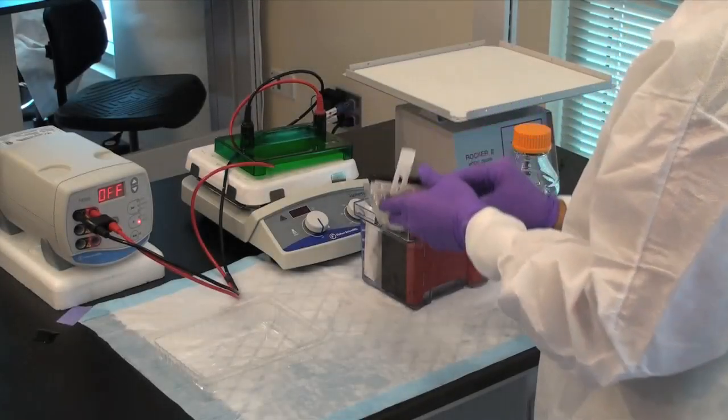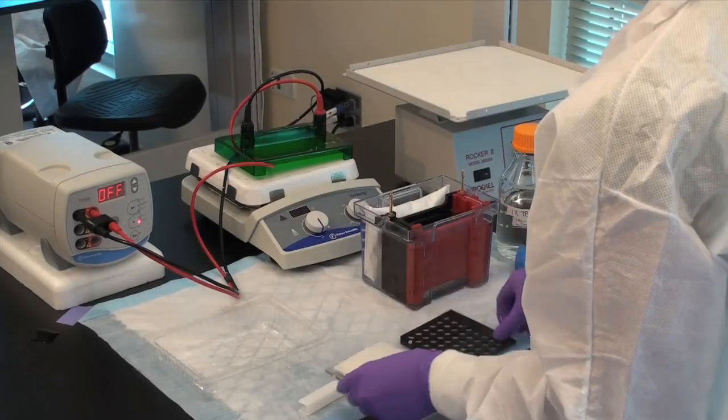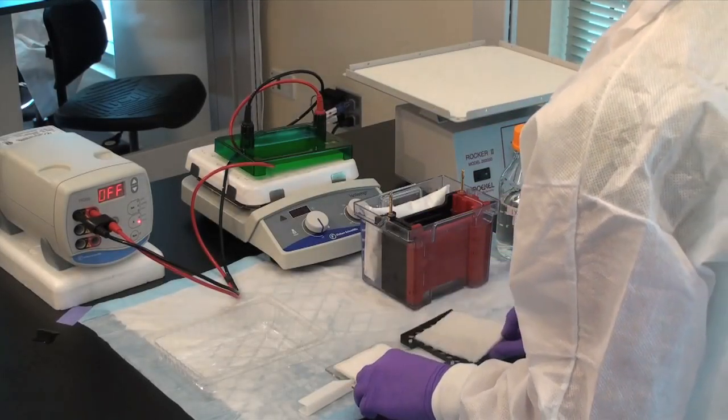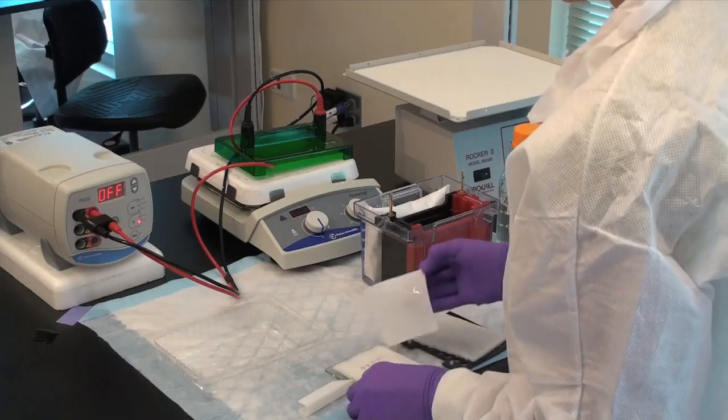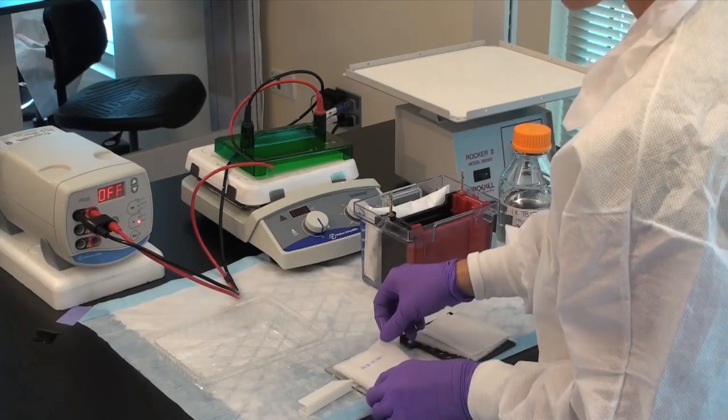Disassemble the sandwich, gently lifting the membrane away from the gel. The ladder should now be visible on the membrane.